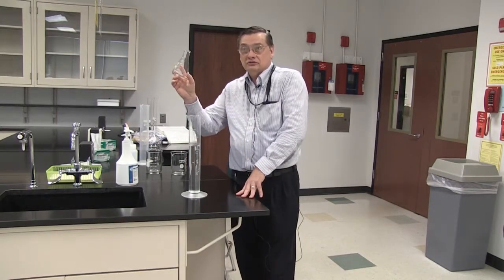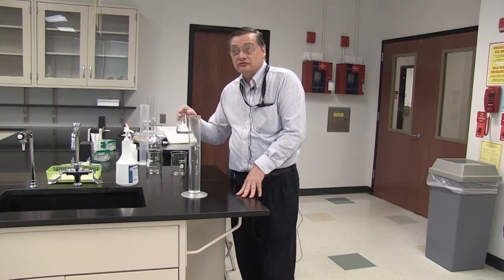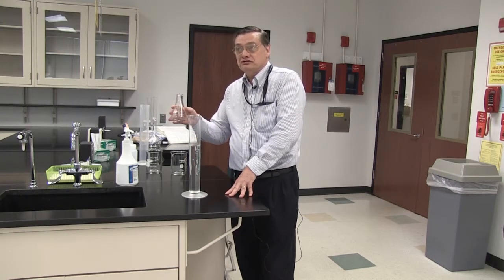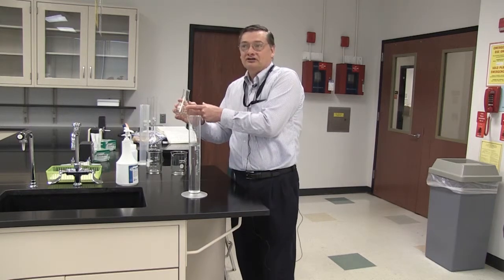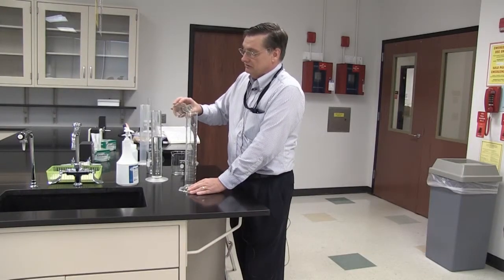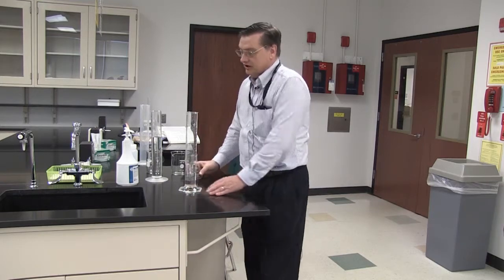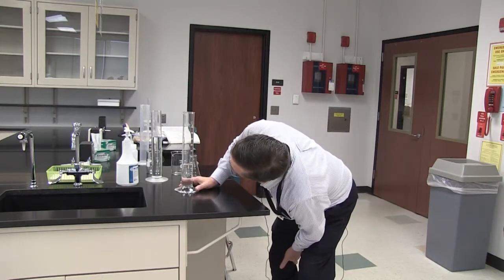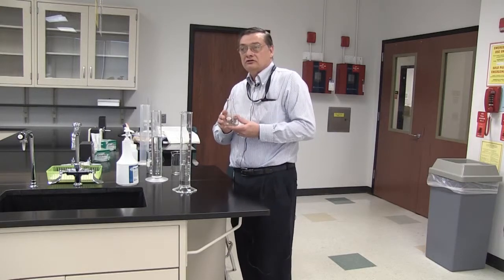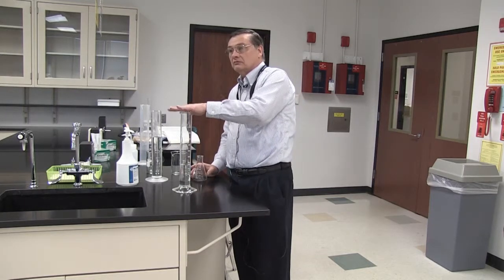The Erlenmeyer flask is also useful for making media, putting in a shaker for shaking things, and it has a nice mouth. You can put a stopper in for various things, but for measuring, it's not accurate, just approximate volumes. Now I put 200 mils of water in this flask, transferred it to this graduate, and we have 185 mils as opposed to 200. There again, not accurate for preparing solutions.